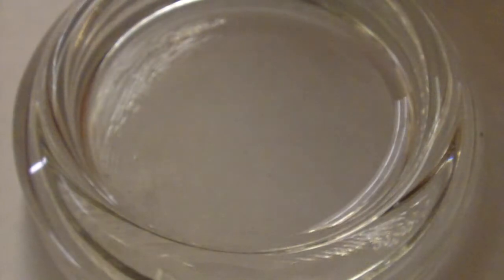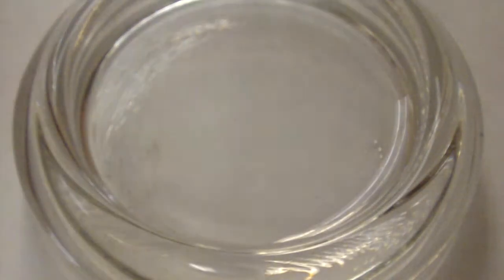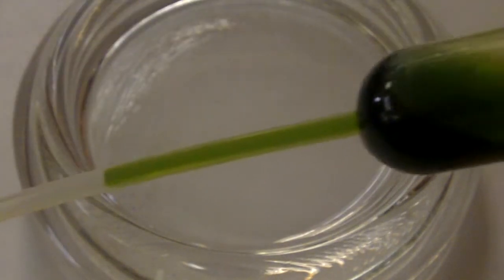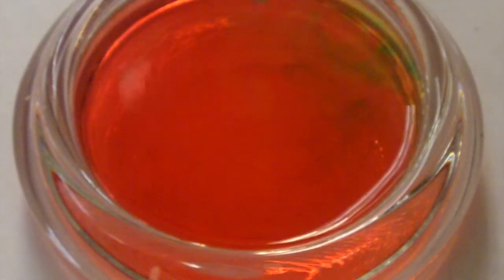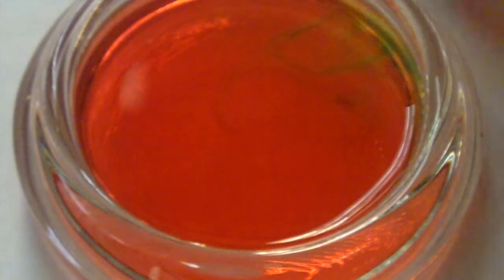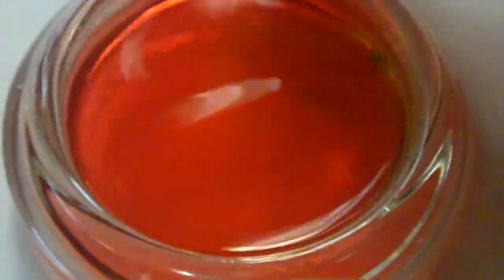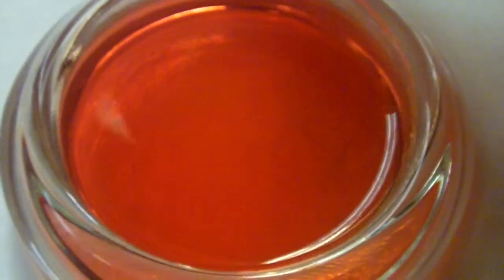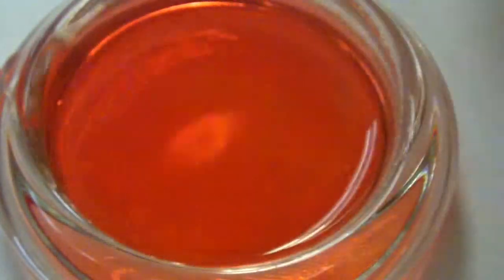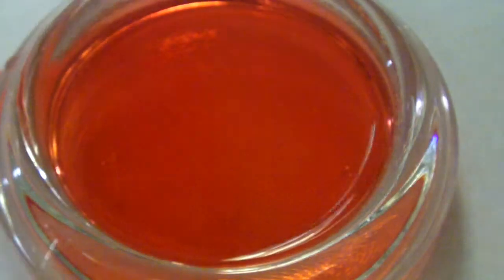The second part of the procedure for magnesium sulfate has us add a dropper full of universal indicator. So we have our universal indicator, dropper full. We're just adding that mixture in there. Well, that looks pretty neat. The universal indicator's main color, as it comes from the stock solution, is green. Looks like we had a little yellow, some orange, but when it's all settled out here, we're pretty red overall. Just spilled a little indicator.